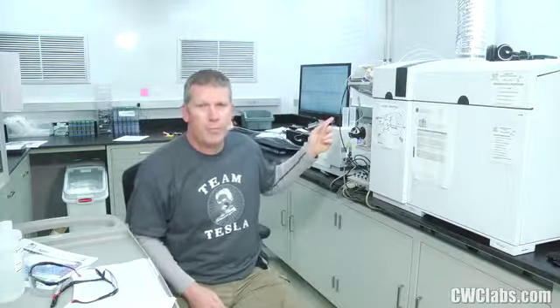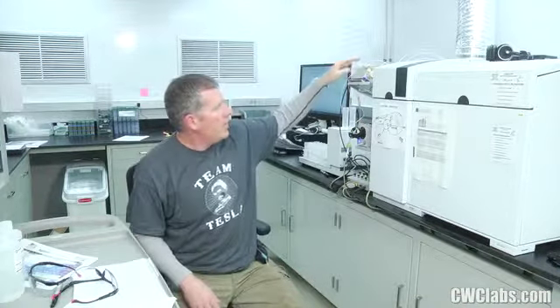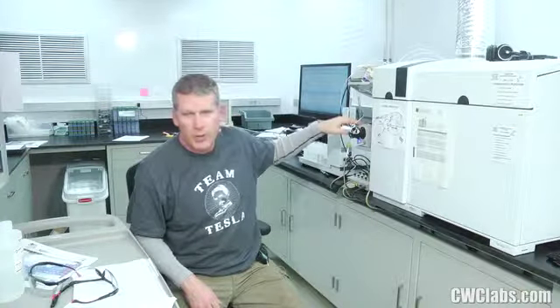But here's another way that I've eliminated virtually all the instrument drift that I used to experience. And for me, that was using this system. It's called the Niagara Plus sample introduction system by Glass Expansion. And it's a two-part system. It has a rotary valve up here at top, and then it has a syringe pump. Now this interfaces with your system. It continues to use your existing peristaltic pump here, and it continues to use your existing nebulizer, of course, and your spray chamber and all that. It simply interfaces into it. It plugs right into your nebulizer.